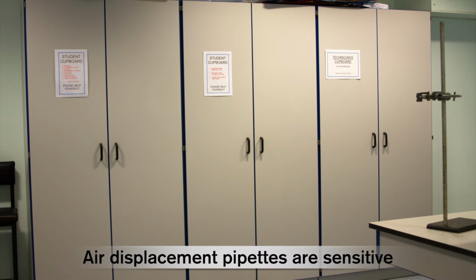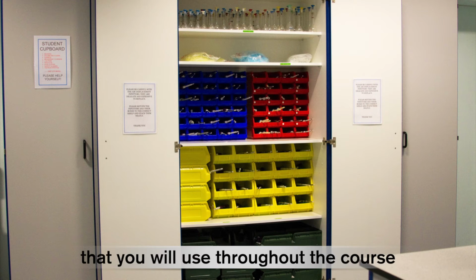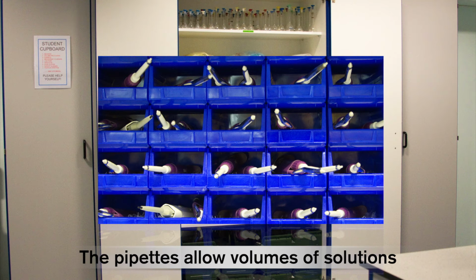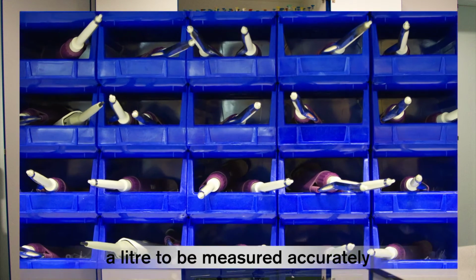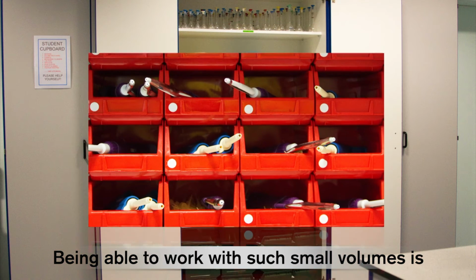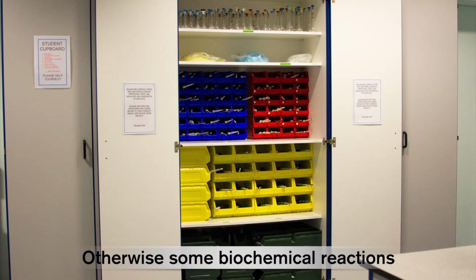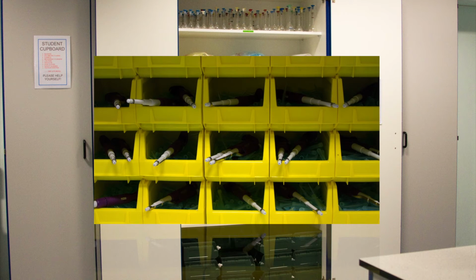Air displacement pipettes are sensitive and accurate pieces of lab equipment that you will use throughout the course. The pipettes allow volumes of solutions as small as 1 microlitre, or a millionth of a litre, to be measured accurately. Being able to work with such small volumes is important, especially where reagents are expensive. Otherwise, some biochemical reactions would need to be prepared in too large a volume.